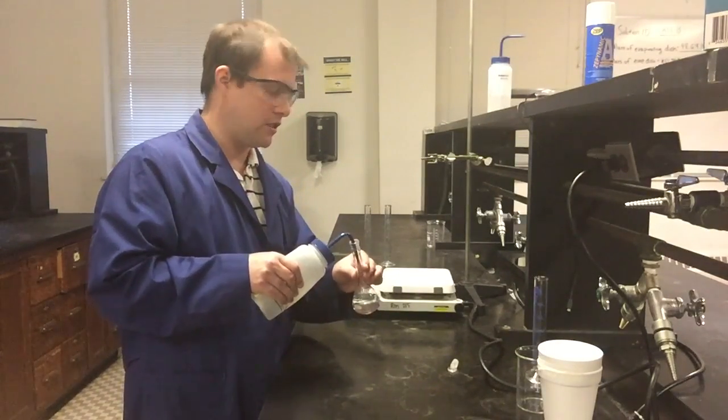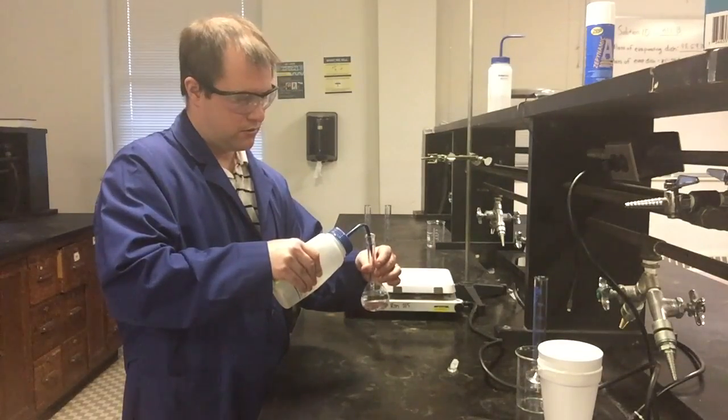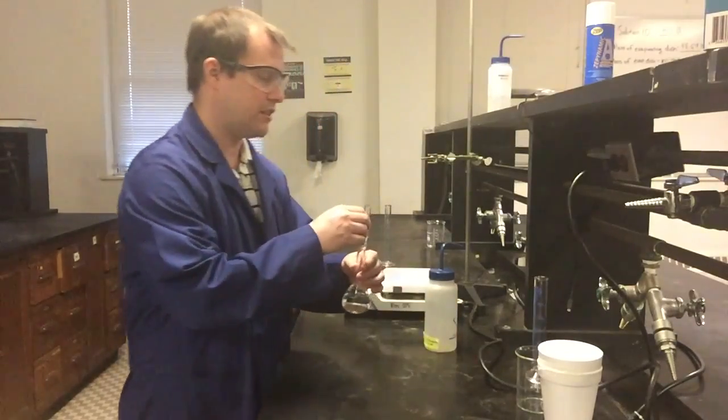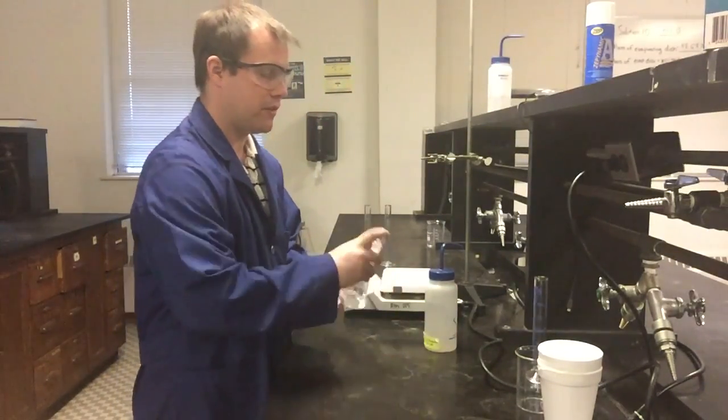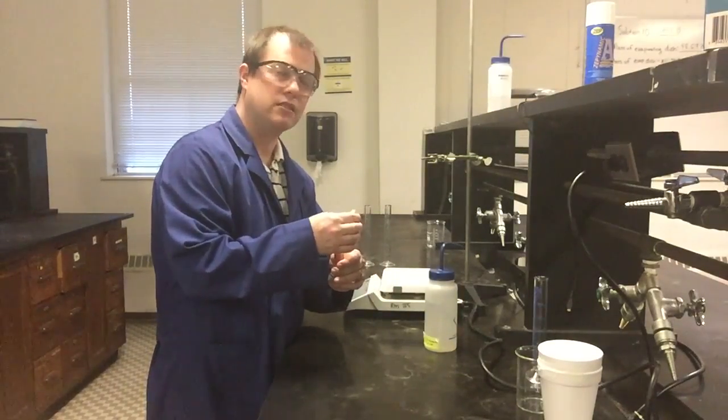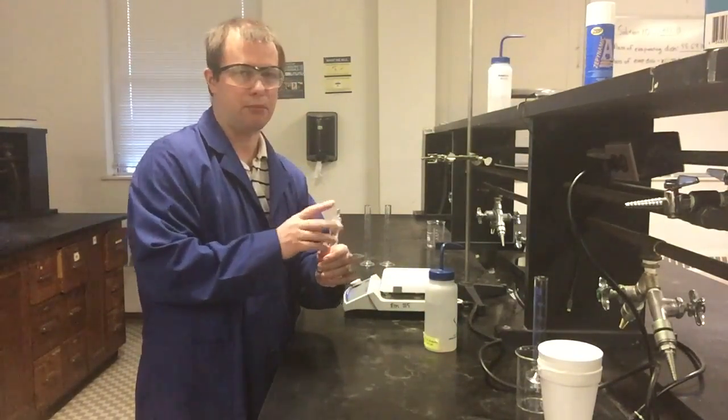So I'm going to go ahead and continue to add a little bit more water here. It's actually probably enough for me to go ahead and start mixing this some. So I'm going to start mixing it up. And remember, as you mix it, like we said before, don't forget to vent a little bit as well, just in case there are any pressure buildups.